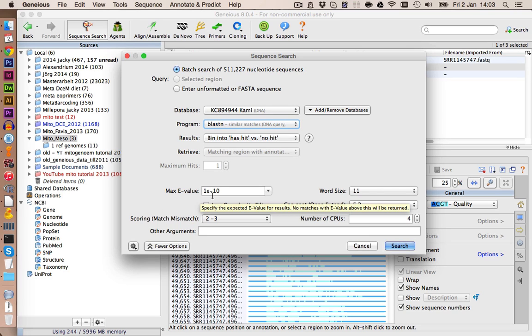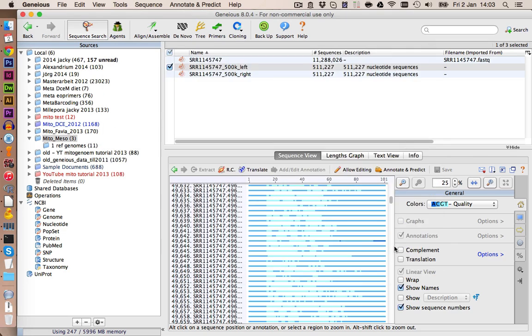As an e-value, this is kind of an indication how good your hit is. We choose a maximum cutoff of 1e-10. So very weak hits, which are not very reliable, will be excluded and not transferred into the hit table. This all looks fine. We can click on OK.